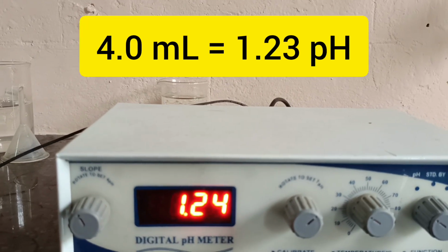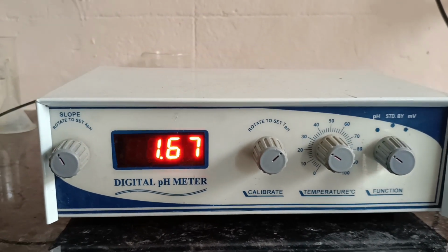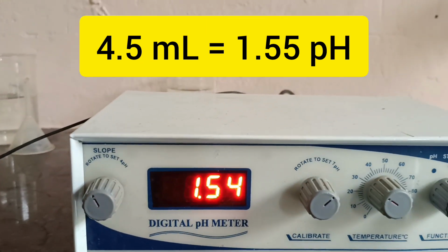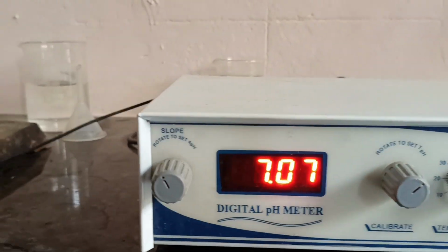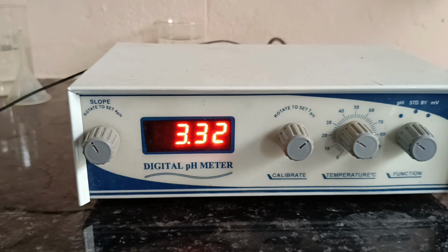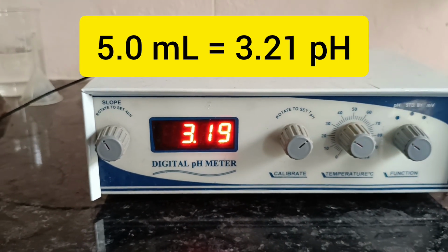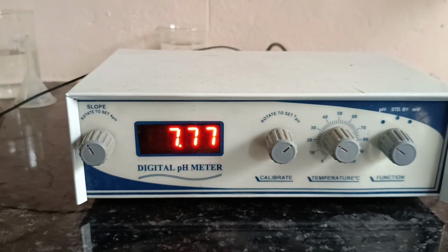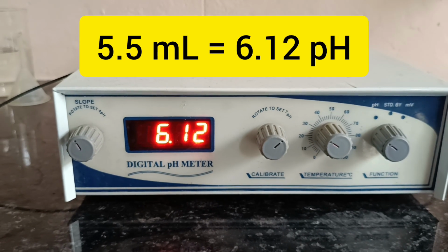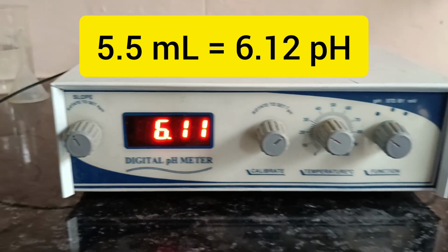See, 4 ml of the solution is added, which shows 1.23 pH. So it has increased a little bit more. 4.5 ml shows 1.55 pH, and after that we will see the sudden jump in the pH value at the equivalence point. Now the pH meter shows the value 3.21 on addition of 5 ml of the solution. So gradually the pH is increasing because the solution is going towards the neutralization, and after addition of 5.5 ml of the solution the pH is now 6.12.